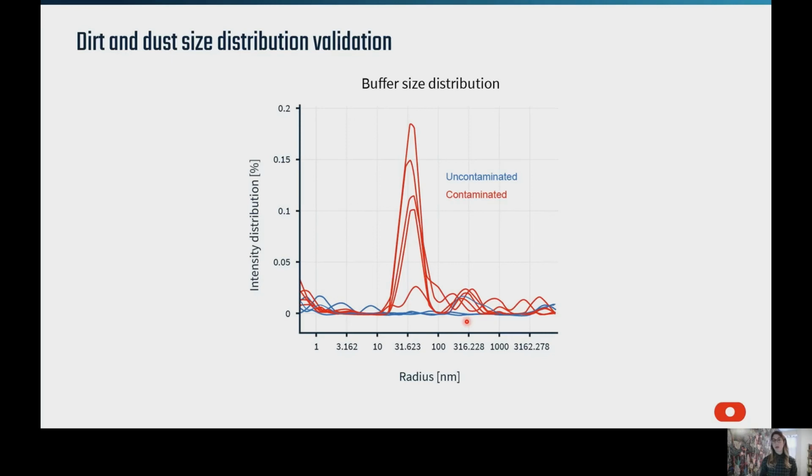Here we can see an example of the intensity distribution plot of a dust-contaminated solution. So the red plot here was a buffer solution that had some dust and dirt in it because it wasn't stored properly or put away. So while it's not always critical to run a buffer blank during your DLS measurements, if you are consistently seeing some peaks or high PDI values that you don't expect in your regular sample solutions, then running a buffer alone to rule out any sort of contamination of dust and dirt would be a great idea. And then you can also filter buffers prior to your DLS experiments as well.